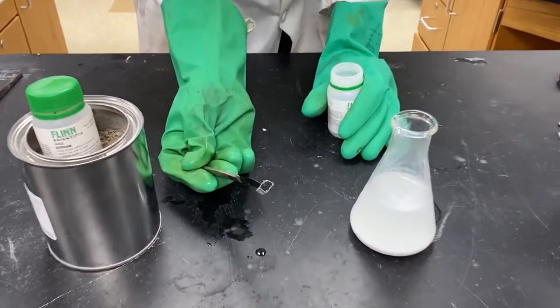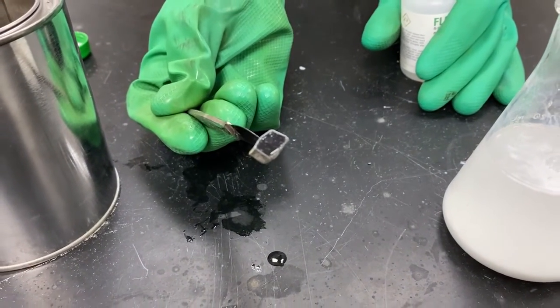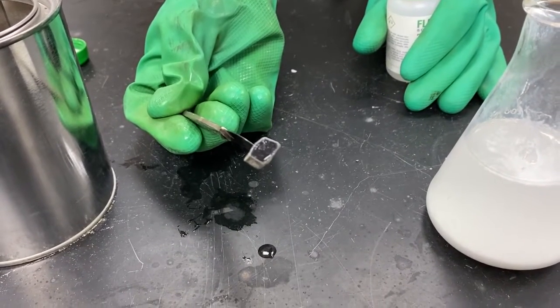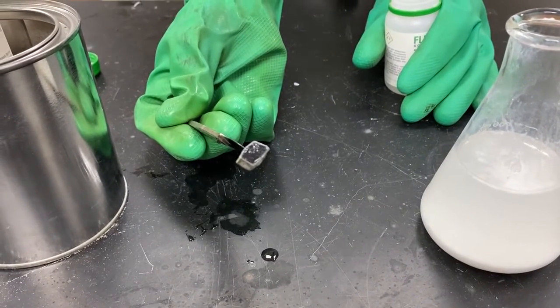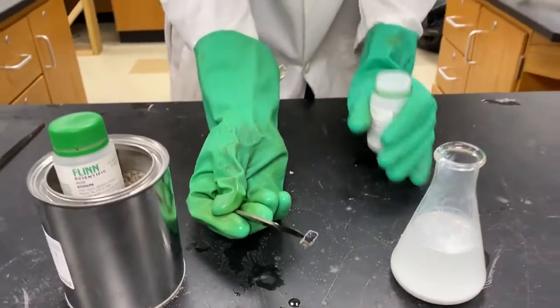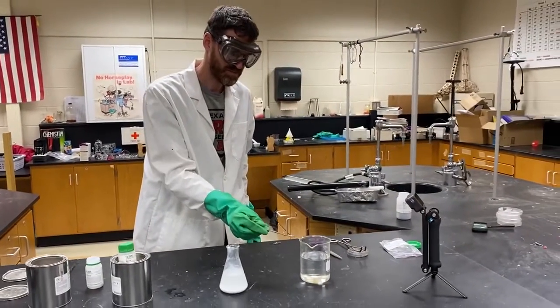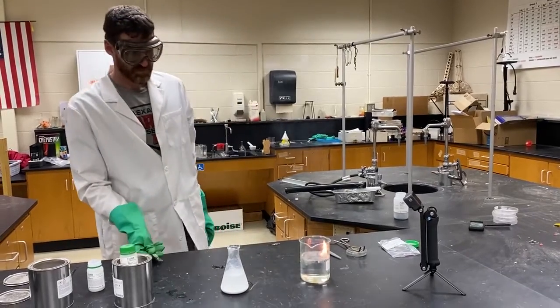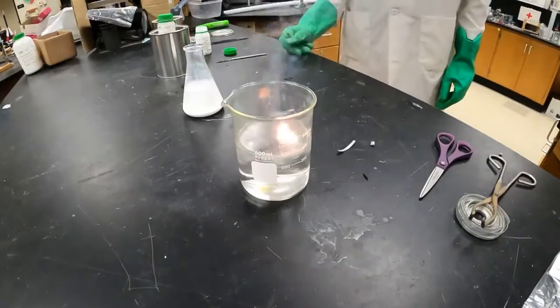And look how black that is. It is oxidized quite a bit under the conditions of the oil and the kitty litter. And this one will self-ignite almost instantaneous. What I want you to do is pay attention to the color, because you'll see a specific color that potassium burns at. Okay, here we go. See the purplish flame? There is a slightly purple flame.